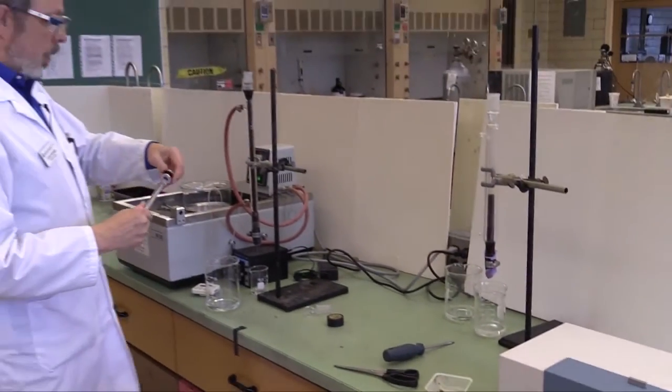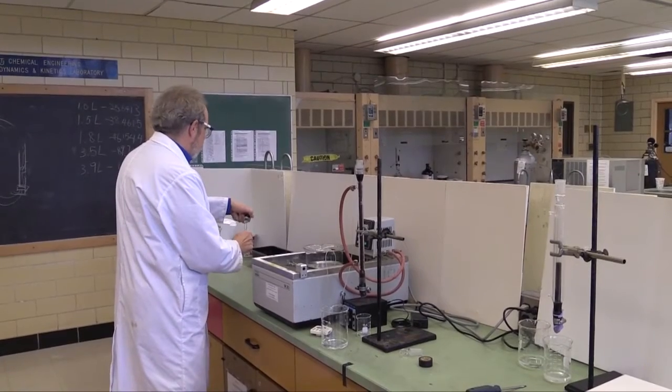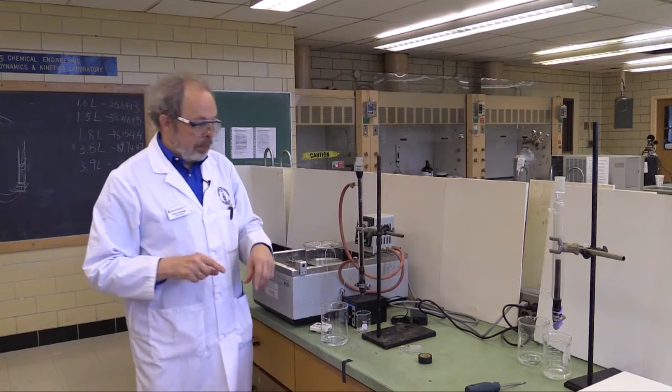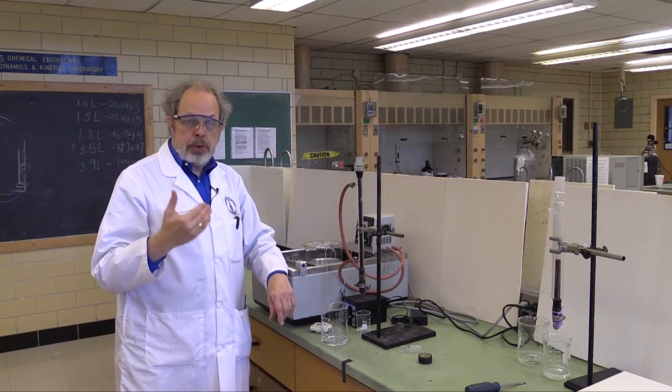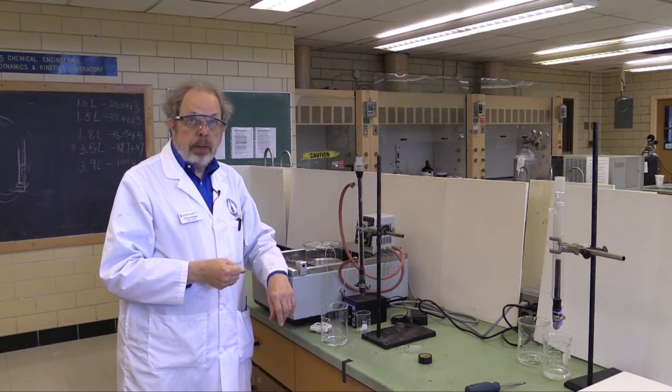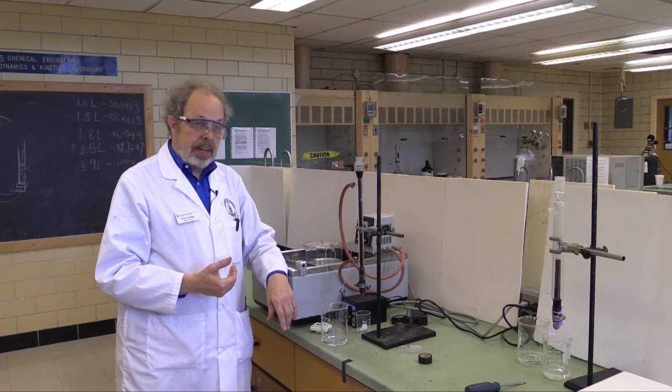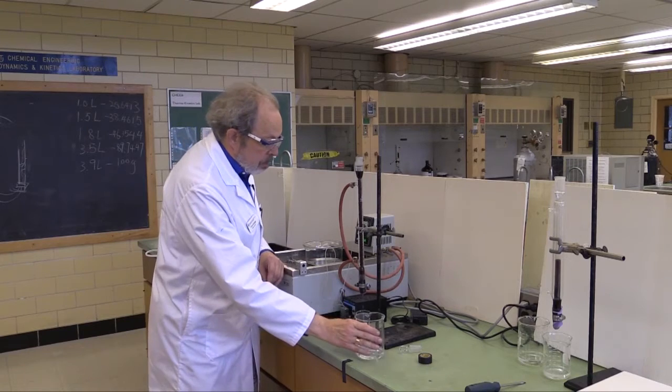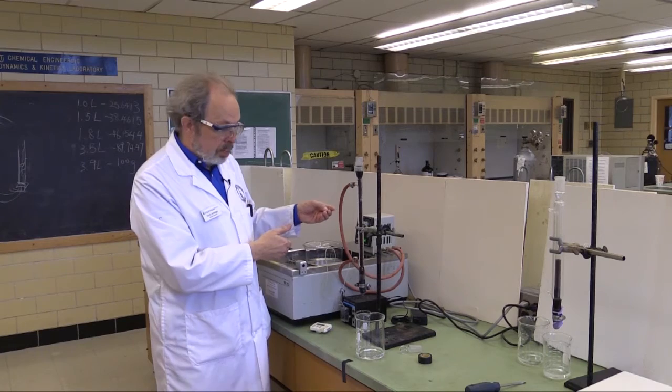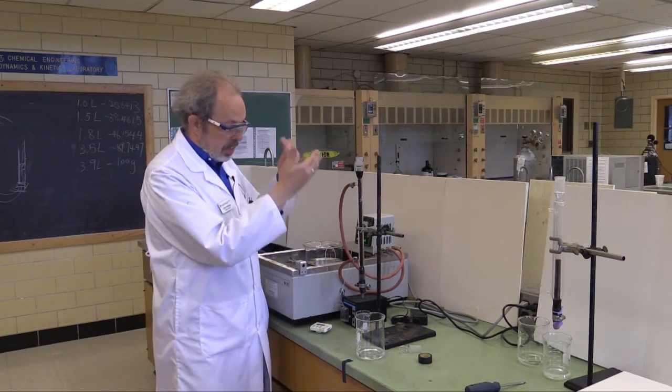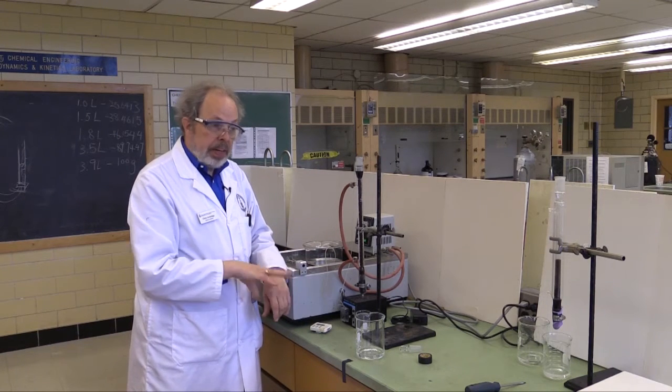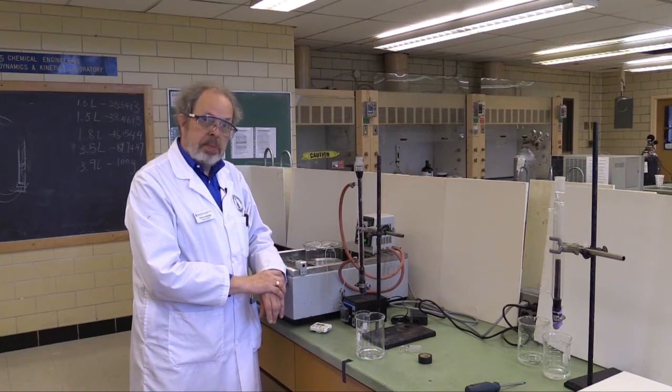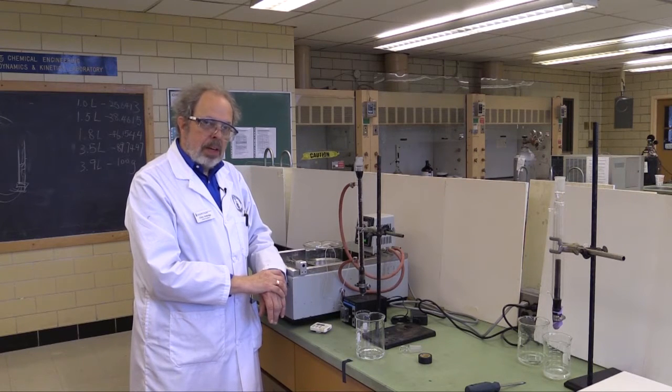Once you have finished this, this solution is now garbage. And you can pour it out, put the cap back on, and pop it back in the warm water bath, ready for the next reading. Now, you need to have three readings consecutively that are within 10% of each other. And that will tell you that the system has reached steady state. It's probably for this reaction about five or seven minutes apart. So, once seven minutes has passed, then collect some more, refill the sample cell, and read it again. And then discard that. The reaction is continuing. And take another reading. You'll need at least three. And if they're not settled down, keep going until you do have three readings consecutively within 10% of each other. Sometimes that takes five readings, six. If you're lucky, it'll be three. Anyway, once you have got three in a row that are finished, you are finished with this reactor, and you're ready to move on to the next one.